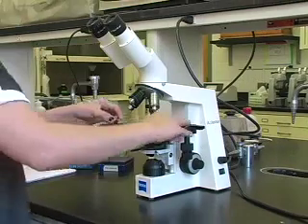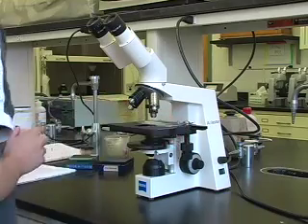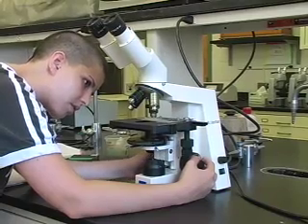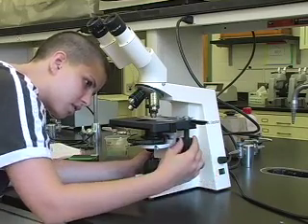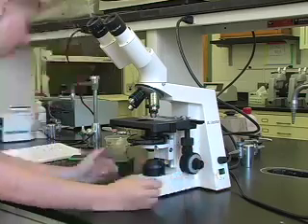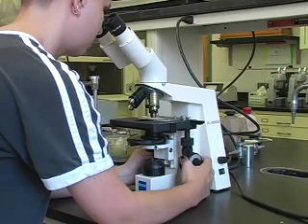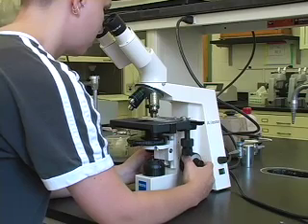Place a slide with a sample on the stage in the specimen holder. Focus on the sample on the slide. Looking from the side, raise the stage to 5mm below the objective using the coarse adjustment knob. Center the specimen under the objective using the mechanical stage controls. While looking through the eyepieces, use the large coarse adjustment knob to slowly lower the specimen away from the objective. You will see a blur of color which will then come into focus.